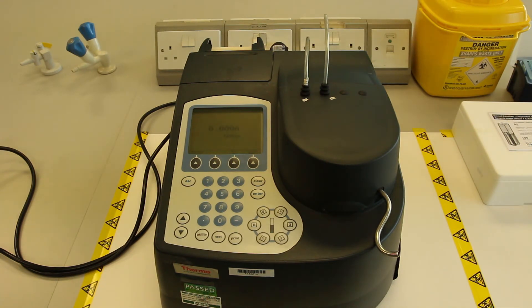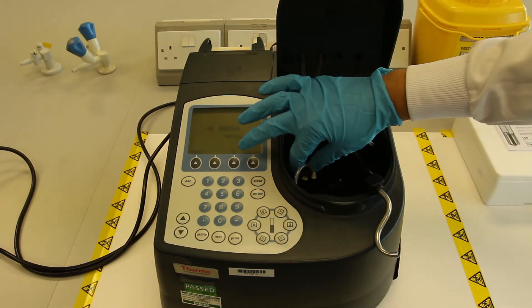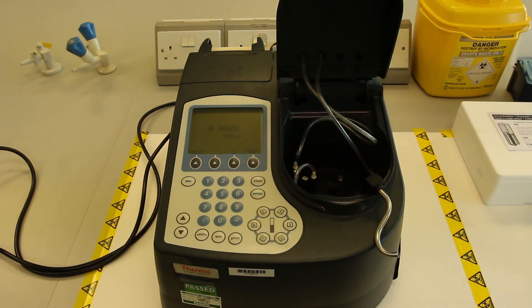You do not need to re-zero samples unless you are intending to measure at different wavelengths. Some machines can hold a blank between wavelengths, but you will have to look at the manufacturer's protocol to check this.